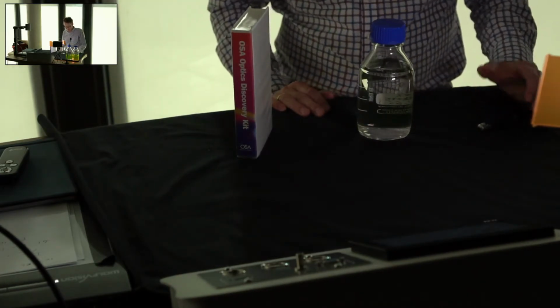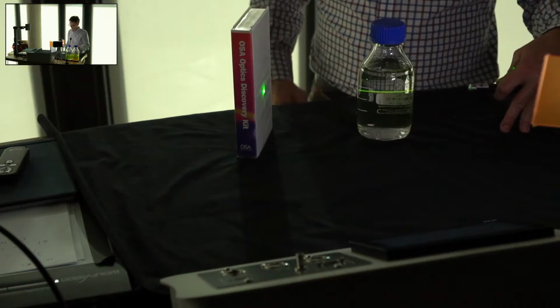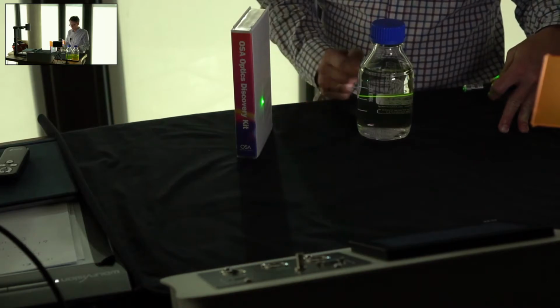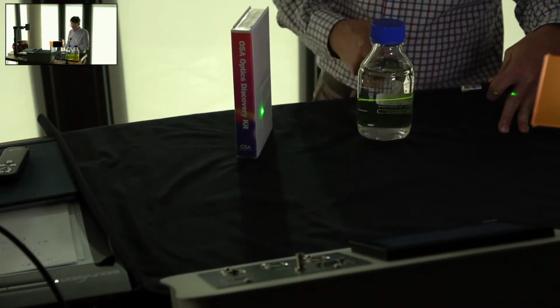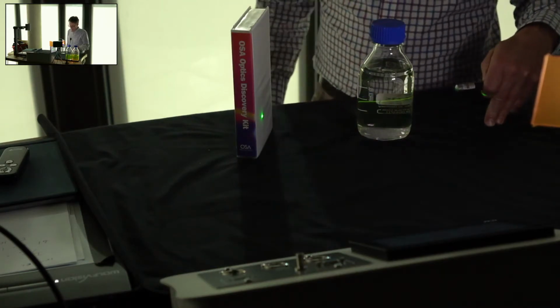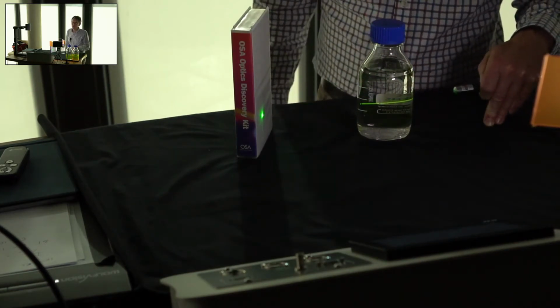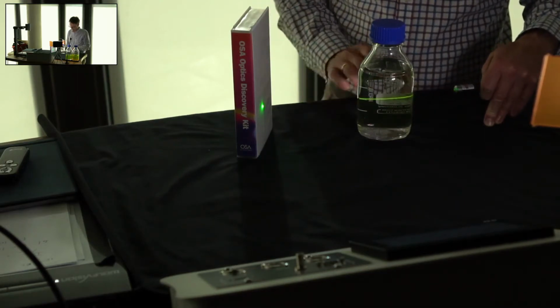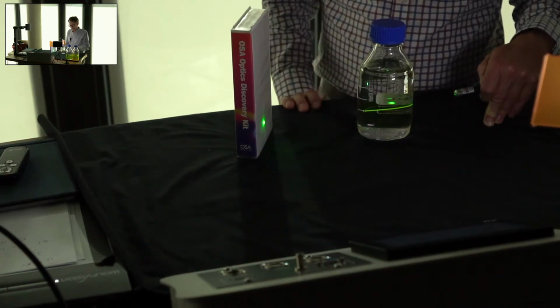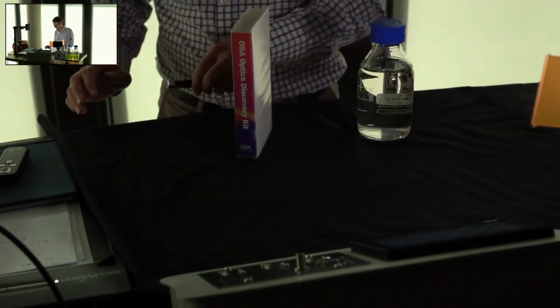There is only signal when we drive the transition. So you see very strong absorption, very strong fluorescence. The light beam is absorbed, although most of the photons go through. The sample is still fluorescing very hard. I would like you to think what the word transparency means. In the region where I'm exciting this fluorescence, the sample is transparent. And I would like you to tell me why the sample is transparent. Why is that the case in that region?